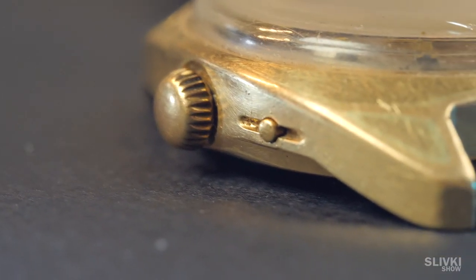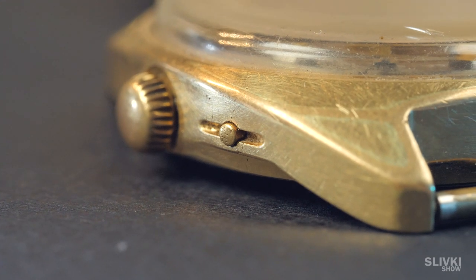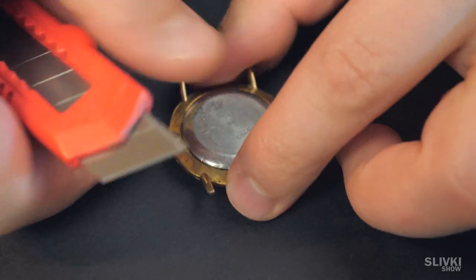We wanted to get gold, but it wasn't easy as it seemed. First, we need to disassemble the watch.